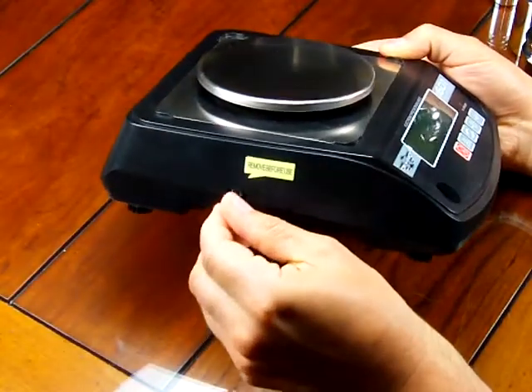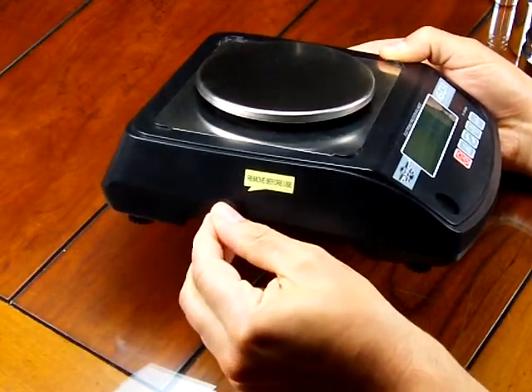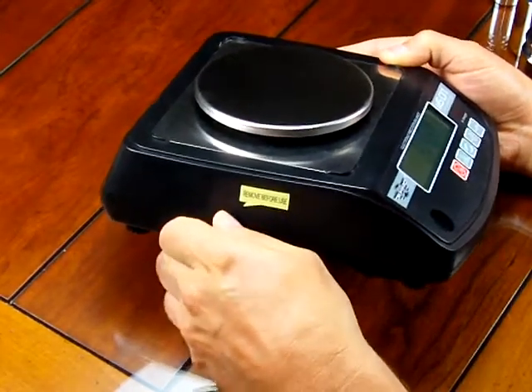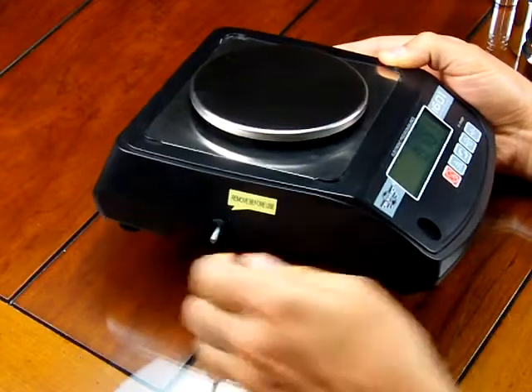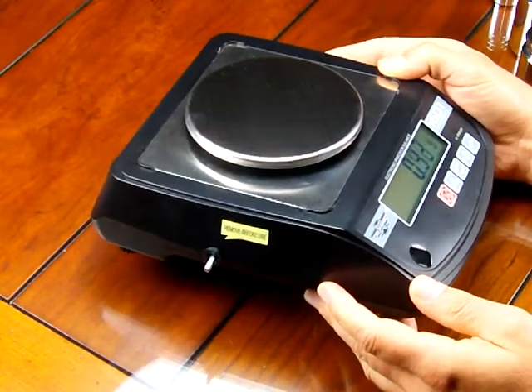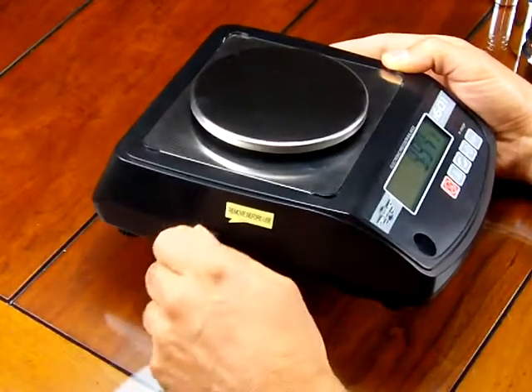So this here is the pin, and when it's delivered, this pin goes right in. It threads right into the load cell, and it prevents the load cell from being damaged in transit. And also, if you're storing the scale, and you're not going to be using it for a while, you should really put that pin in.